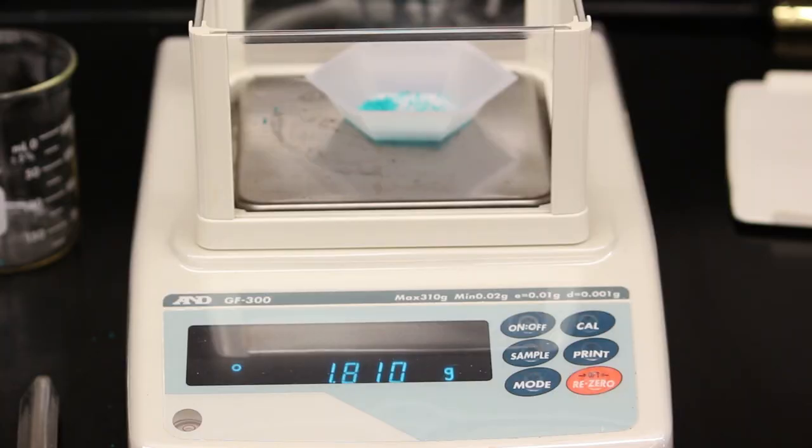Once the balance stabilizes, record your mass in your lab manual to three decimal places. The digital balances are accurate to the milligram.